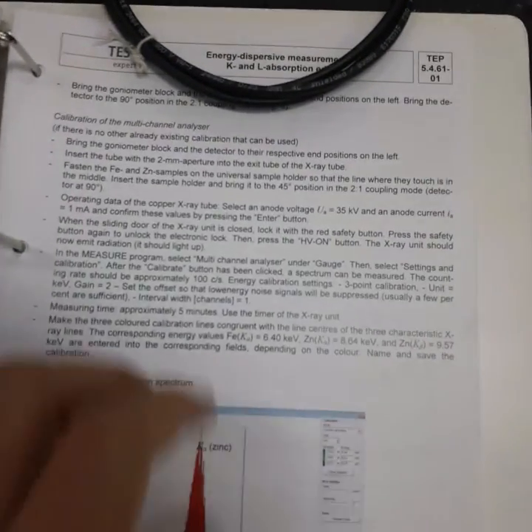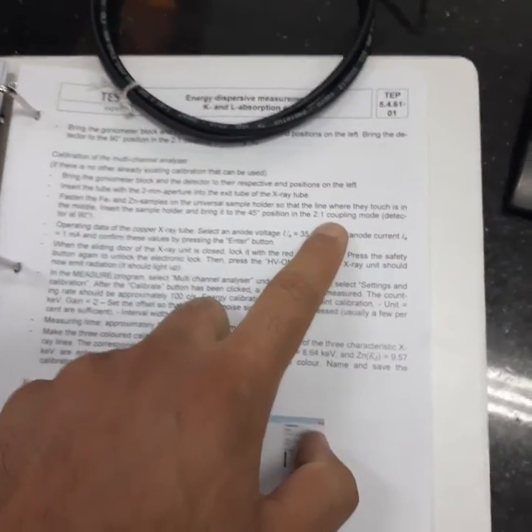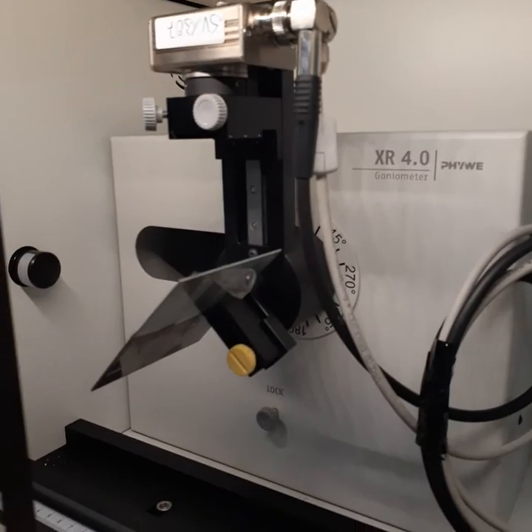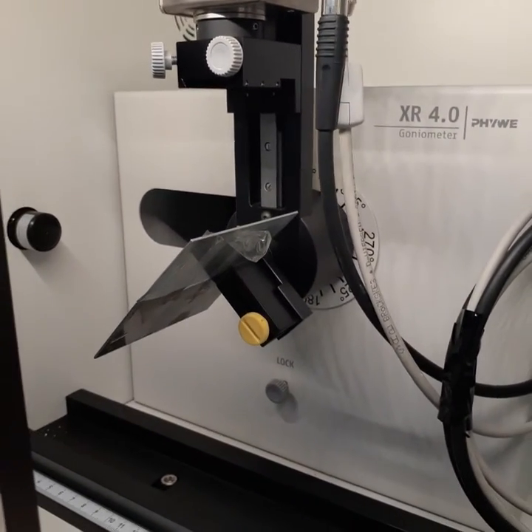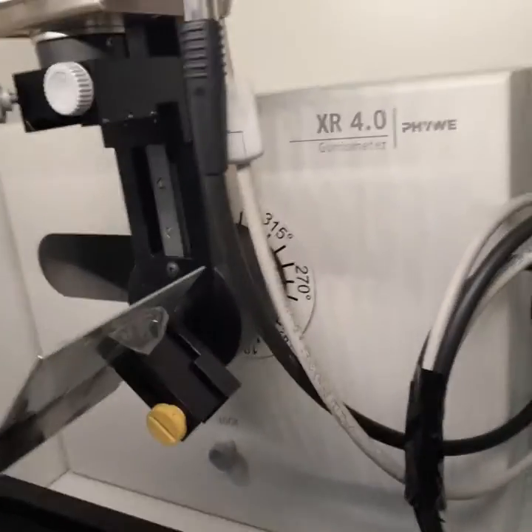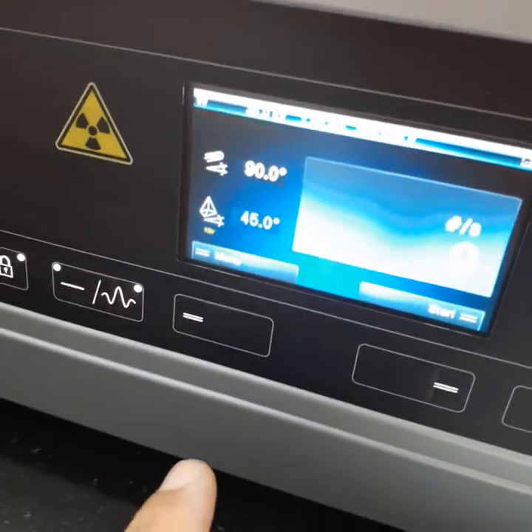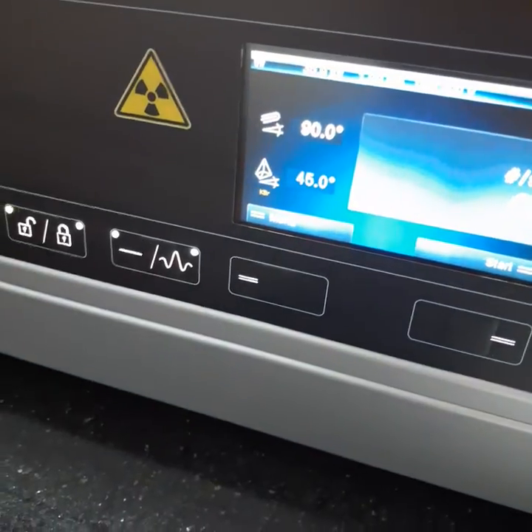And according to the instruction in the manual, we would like to use the 2-to-1 coupling mode, where the detector is at 90 degree. As you can see here, we have set the detector to 90 degree, and the two plates of zinc and iron are at 45 degree. Now we will close this door. Then we would like to give a look to the coupling mode, where the detector is at 90 degree and the sample is at 45 degree. Now everything is okay according to the instruction in the manual here.